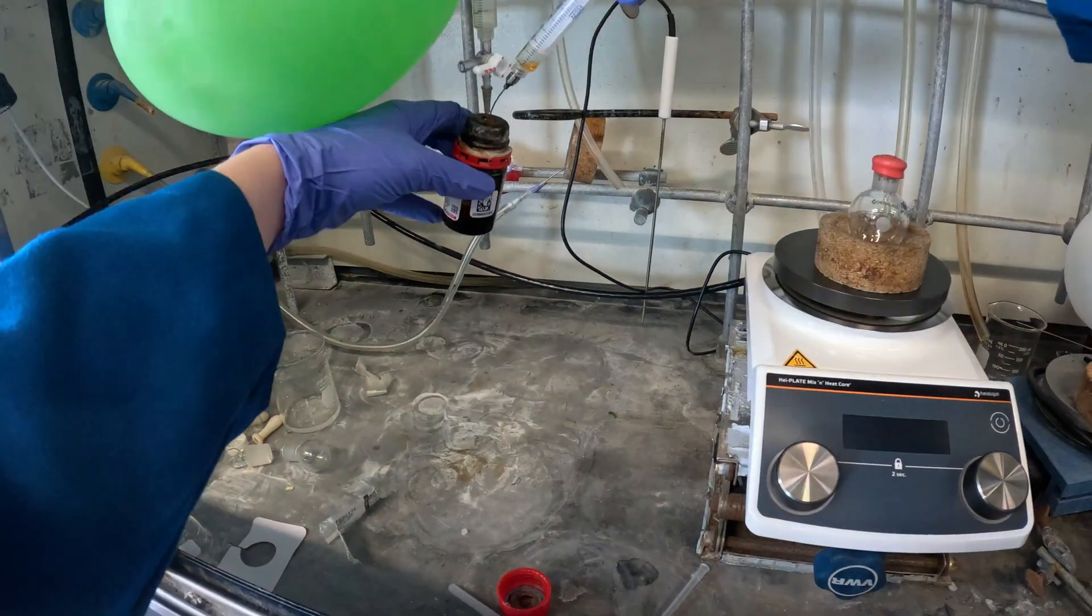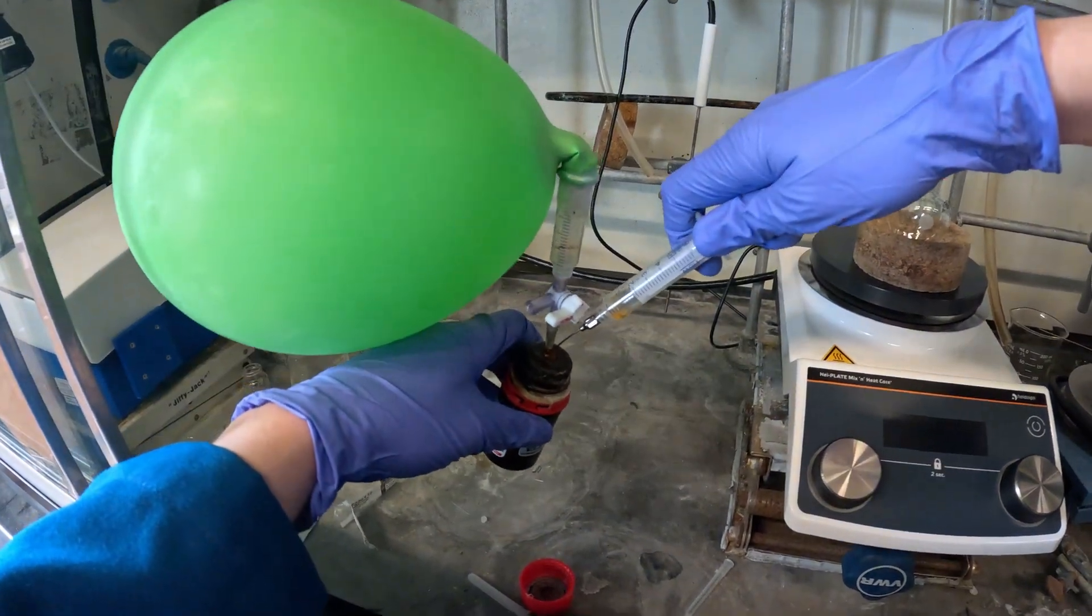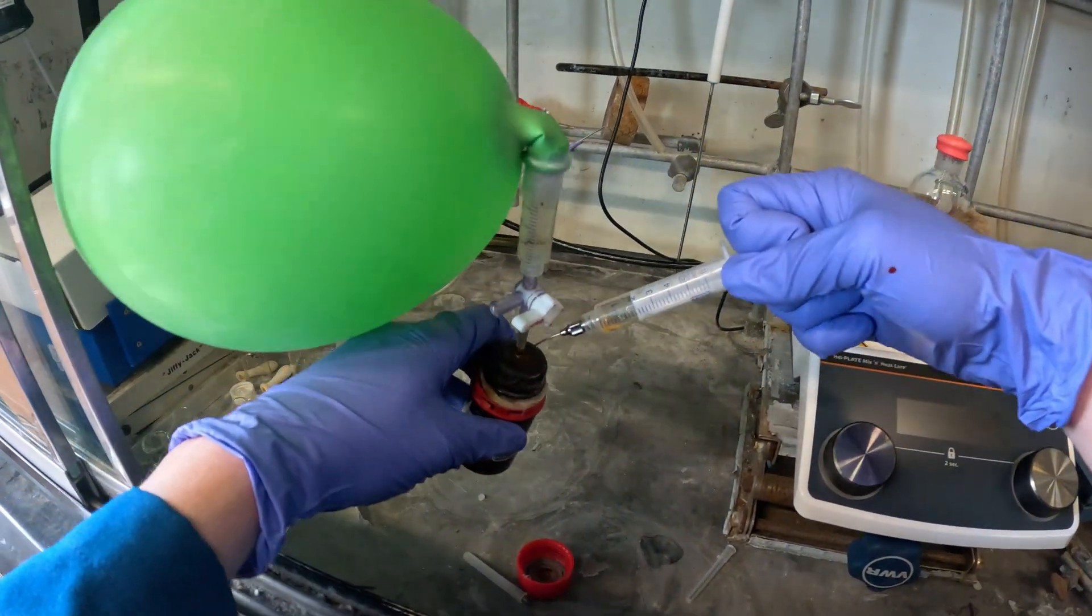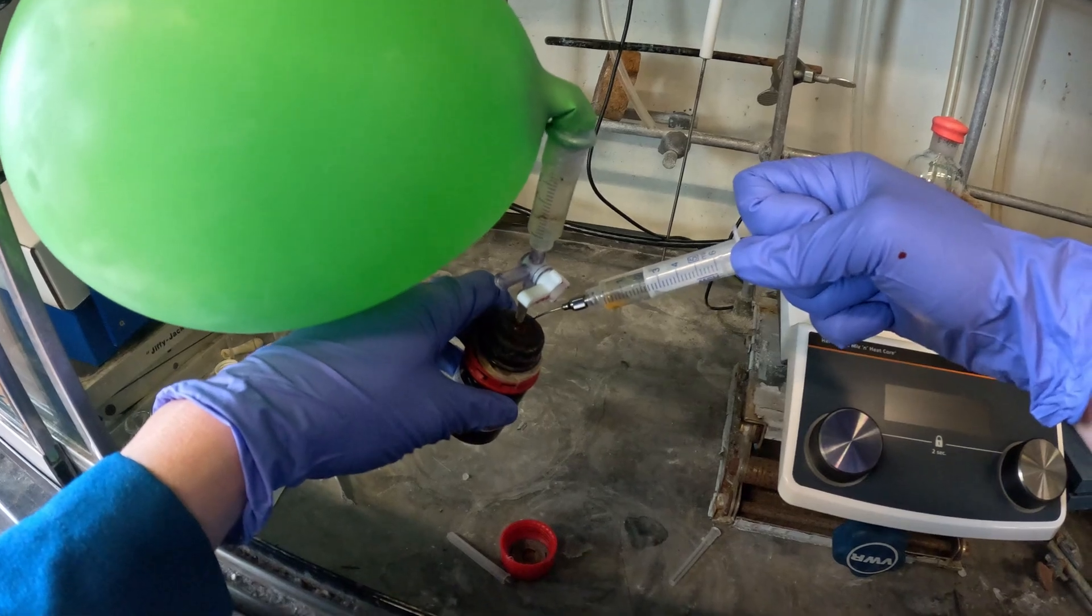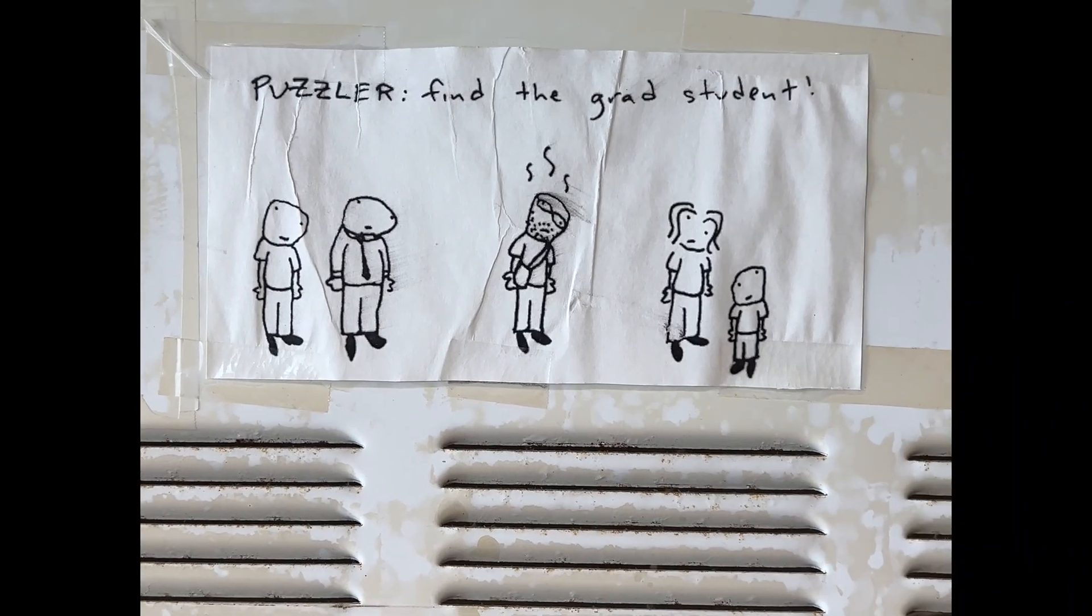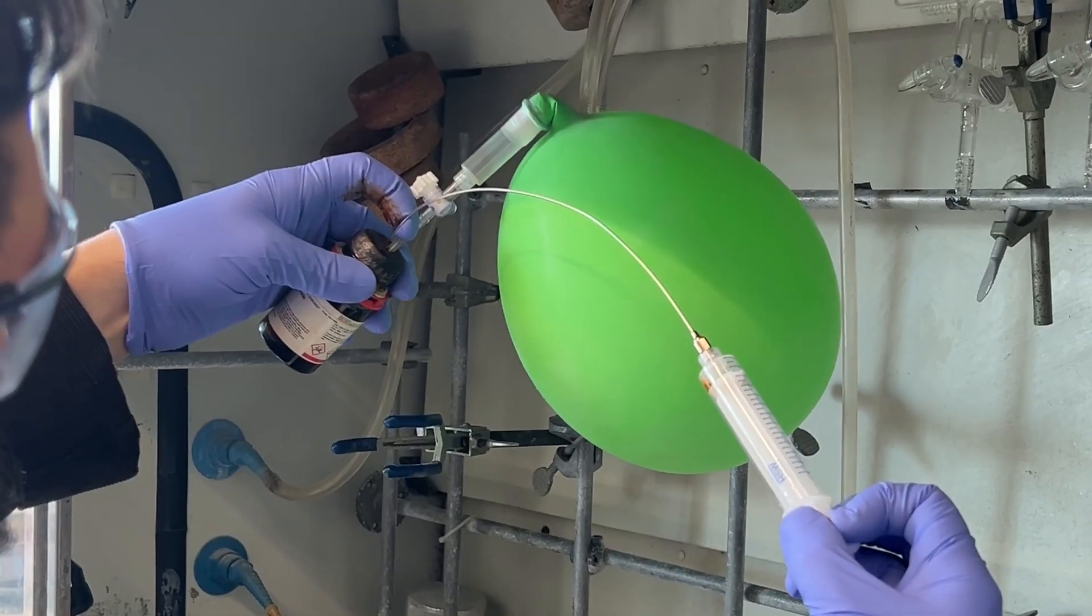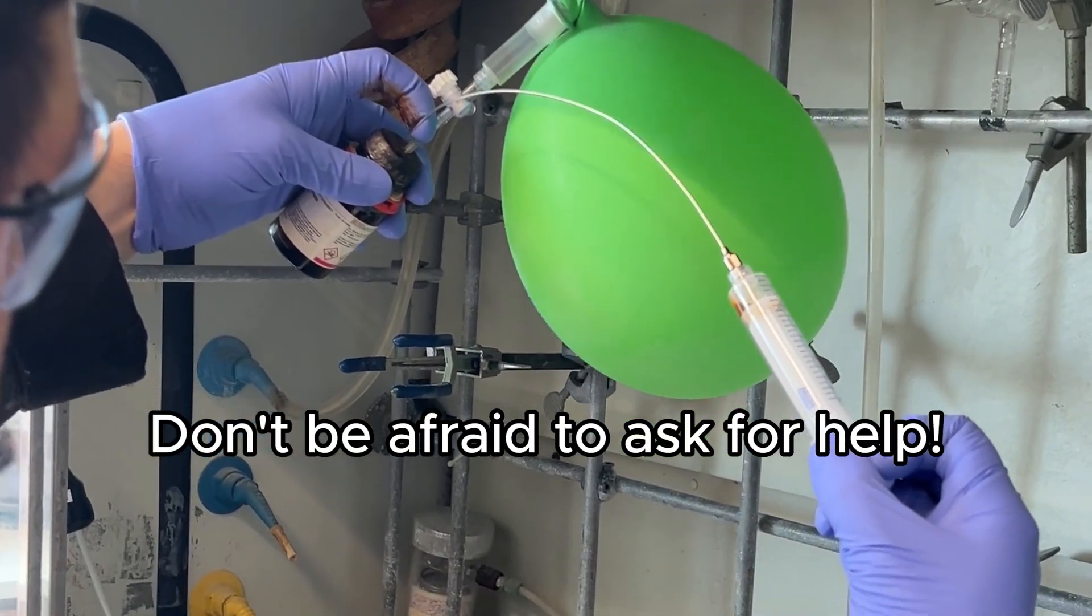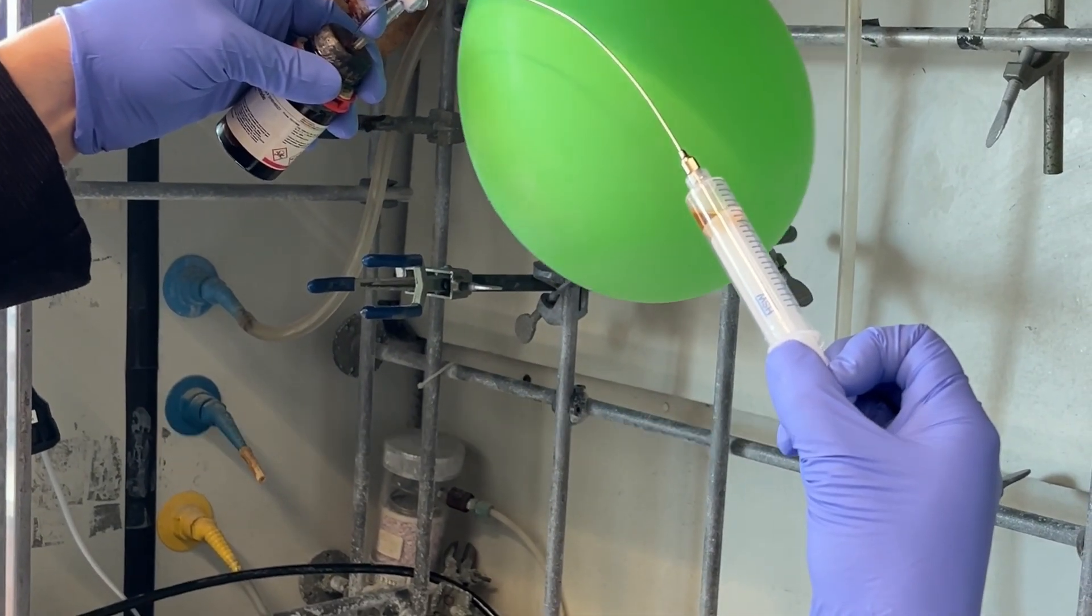I might need to call in some help because this isn't working for me. That's me in the middle, right there. All right, I called in the big guns. Don't be afraid to ask for help, especially if you're a beginner like me.